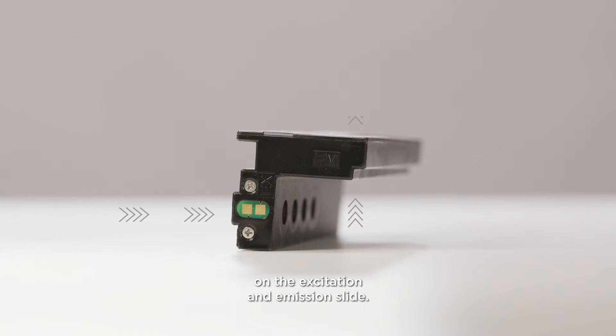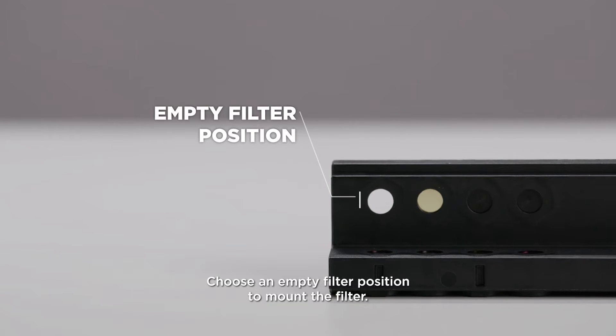Watch the direction of the light path on the excitation and emission slide. Choose an empty filter position to mount a filter.